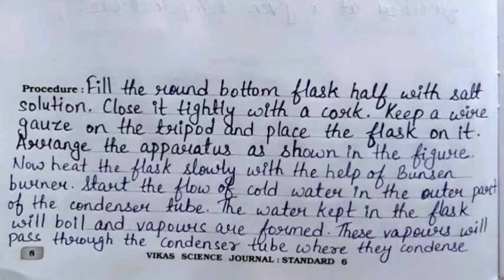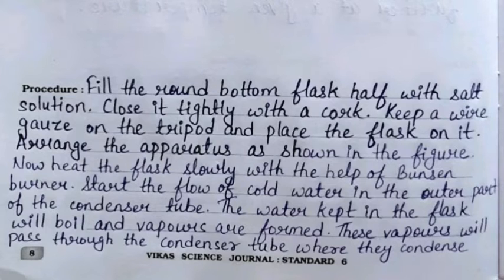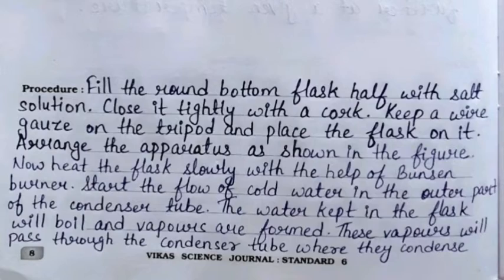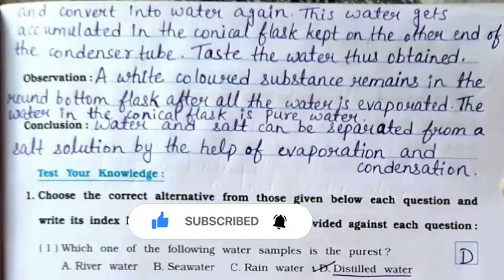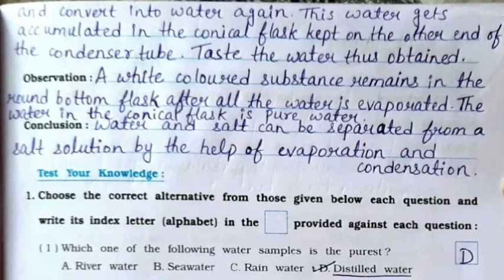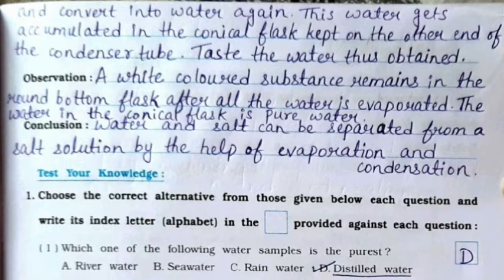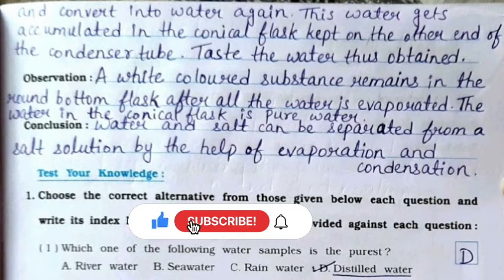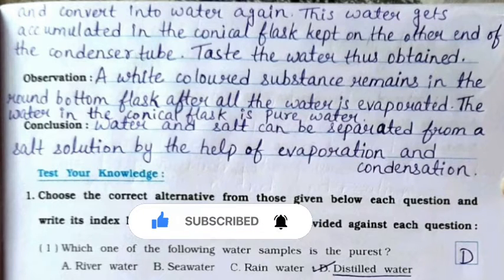Start the flow of cold water in the outer part of the condenser tube. The water kept in the flask will boil and vapors are formed. These vapors will pass through the condenser tube where they condense and convert into water again. This water gets accumulated in the conical flask kept on the other end of the condenser tube. Taste the water thus obtained.